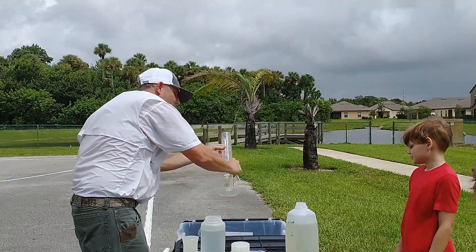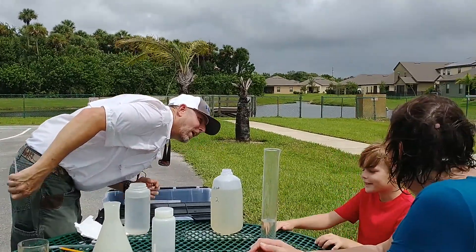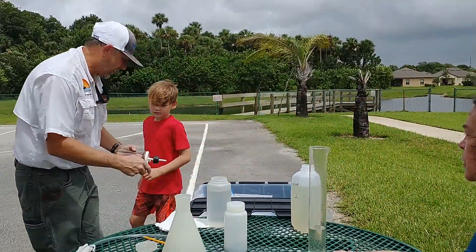This is as precise as cooking — baking, really. So now we can't pour that in yet, so you've got to come over here. You've got to take my water and clean this.